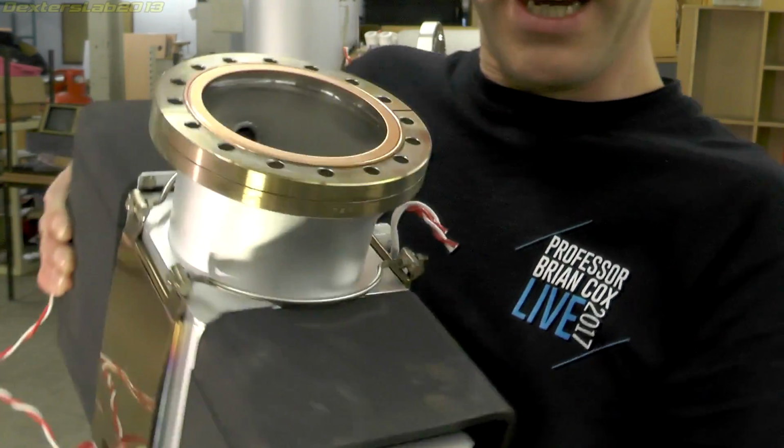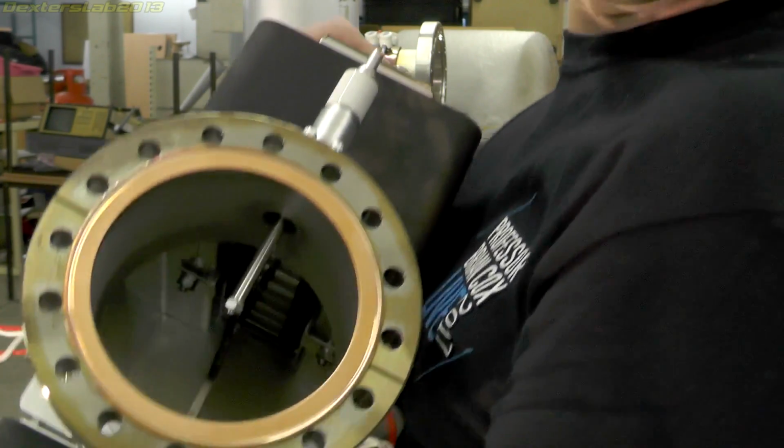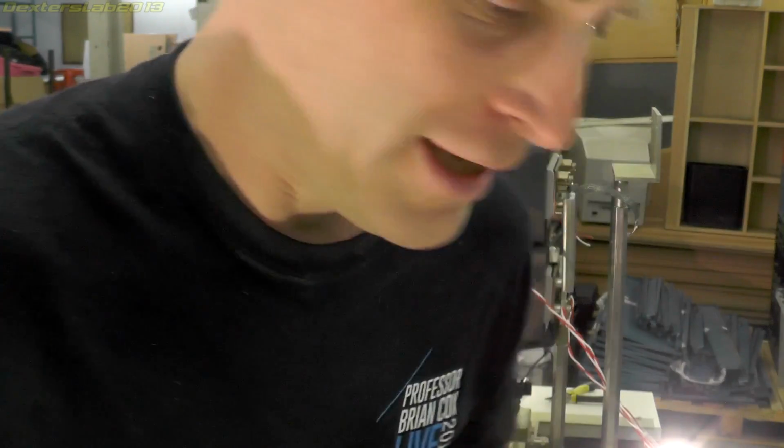So here we have the enormous main ion pump. We'll have a look at that in a bit more detail a bit later, but that is heavy. I think the data sheet said 23 kilos.